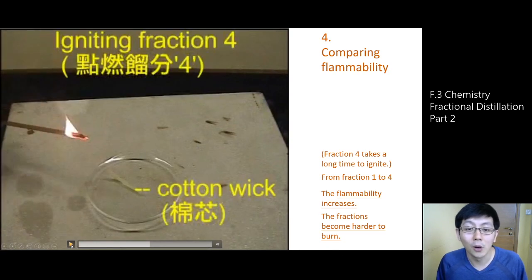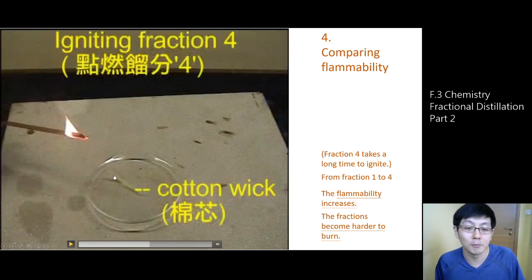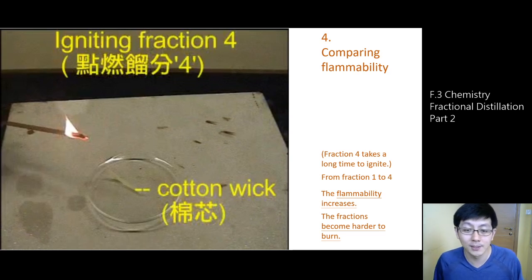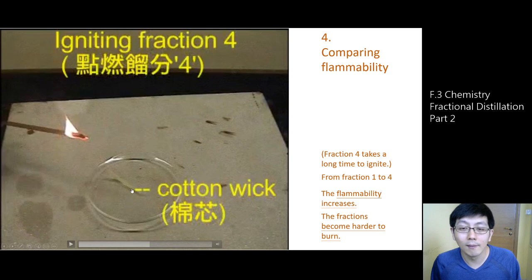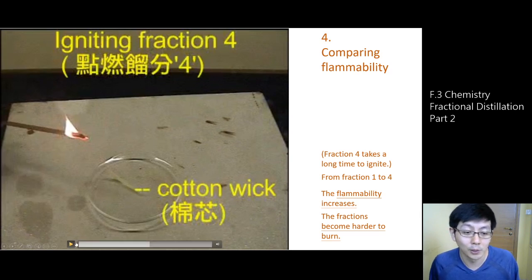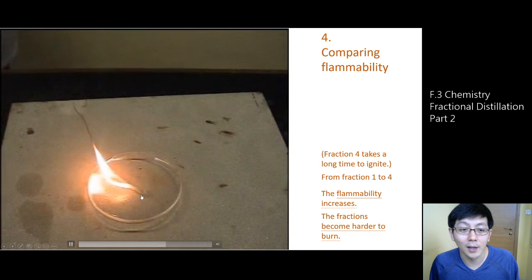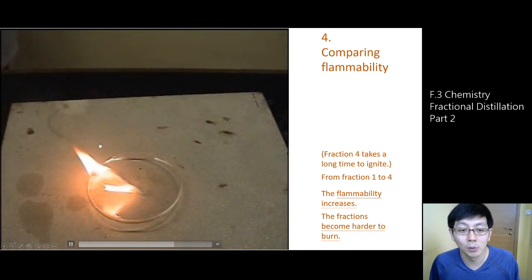To burn fraction 4, we may use a trick — a cotton wick, just like the wick inside a candle. We try to burn the wick and keep the fire going longer to try to ignite fraction 4. Eventually you can burn it, and you can see some black smoke being produced.